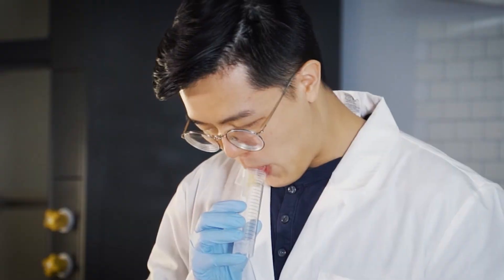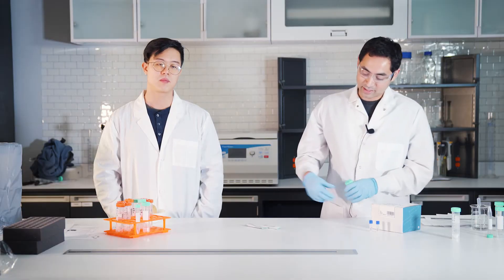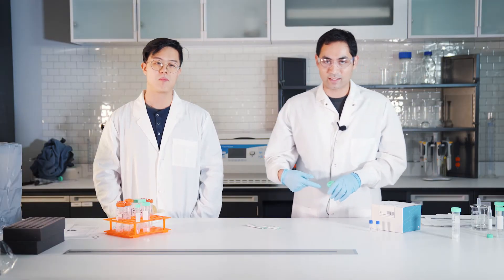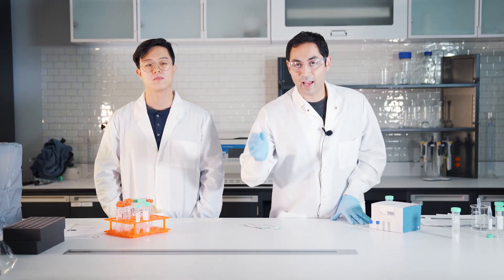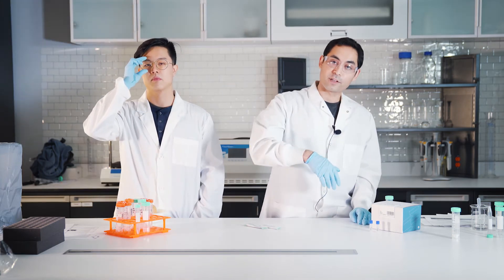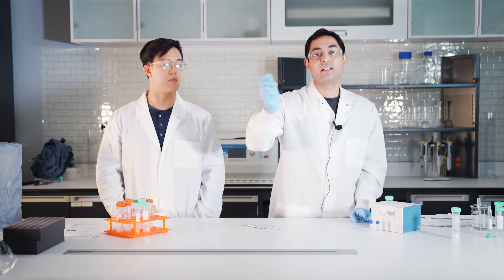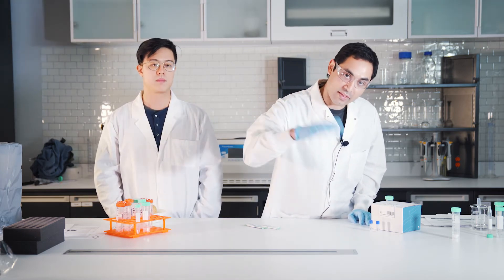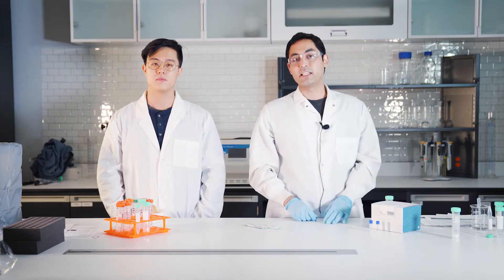Let's add the QuEChERS salt. Case in point, when you're adding samples to the tube, you want to make sure you go matrix first, and then salt. Don't go salt and then the matrix after - it'll create too much heat, you don't want that, you're going to get crappy recoveries. Remember, you want to add the salts last.